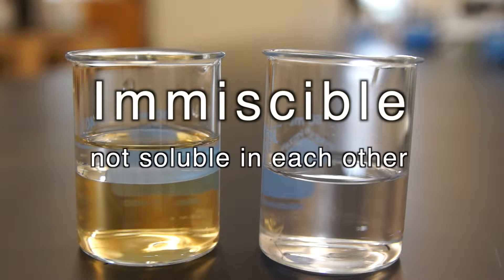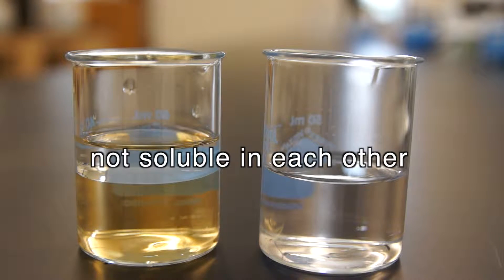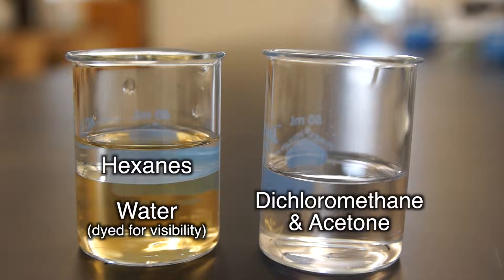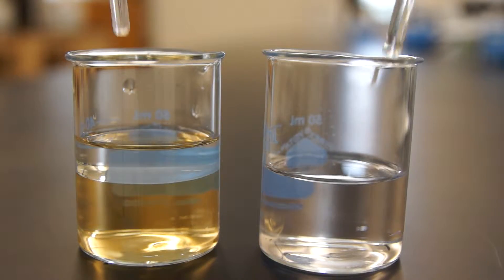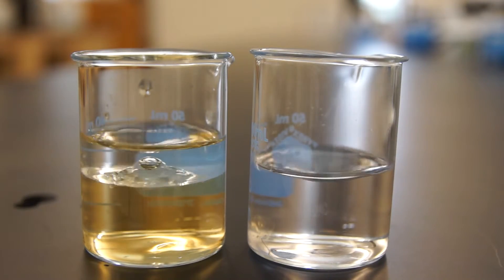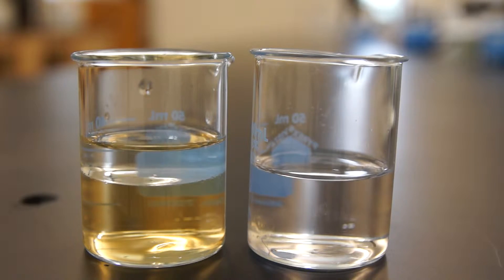But what does being immiscible mean? Immiscibility means that the two solvents are not soluble in each other. In this demonstration, we've put hexanes and water on the left, and dichloromethane and acetone on the right. As you can see, even after vigorous stirring, the hexanes and water don't mix, while dichloromethane and acetone stay mixed with each other. The hexanes and water are said to be immiscible.